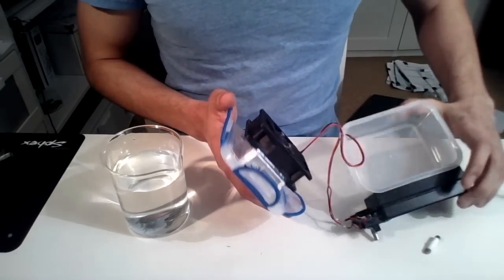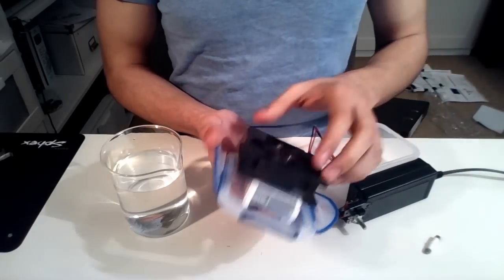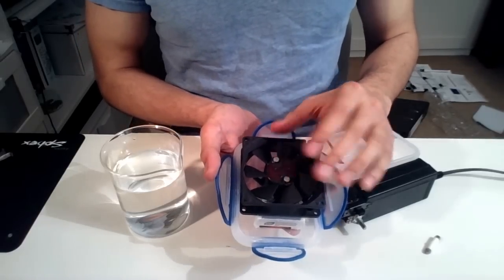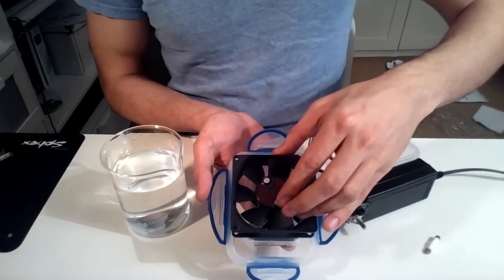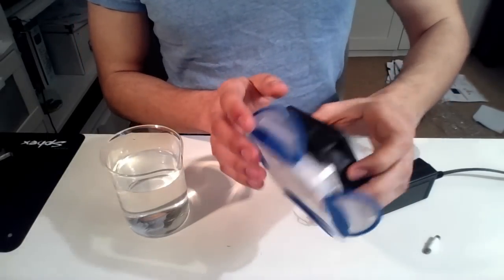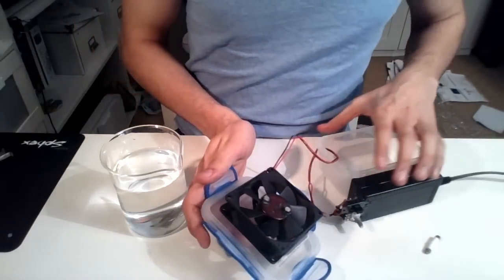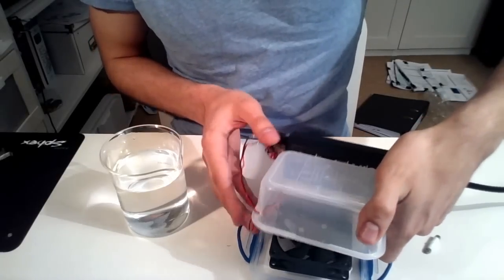So what I've got here is an old lunchbox. And what I've done is I've taken an old PC fan and glued two neodymium magnets, otherwise known as rare earth magnets, about the same distance from the center, just so when it spins it's not off center. And I put an old tic-tac box just underneath it to hold it up high enough underneath the top so that the magnetics can work. And just close that back up.